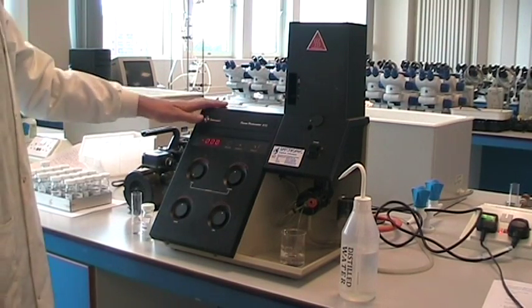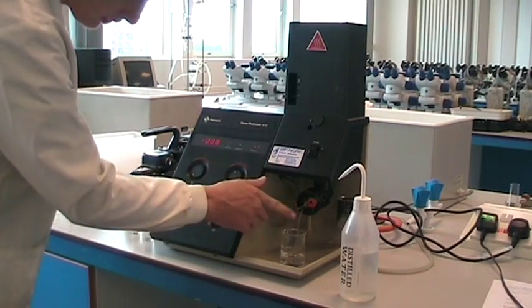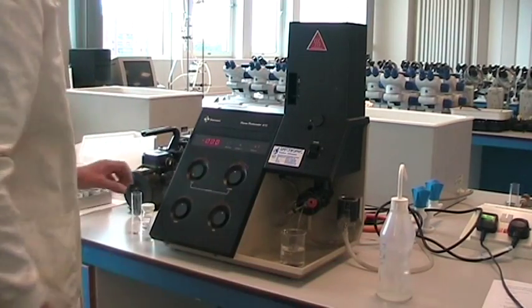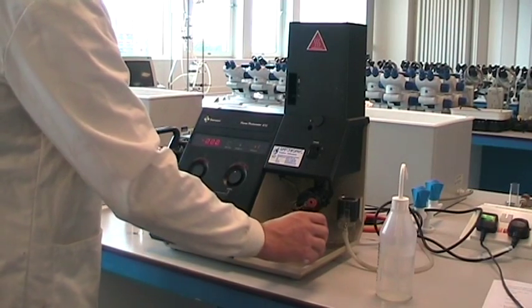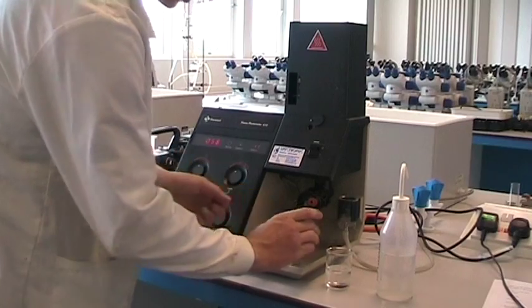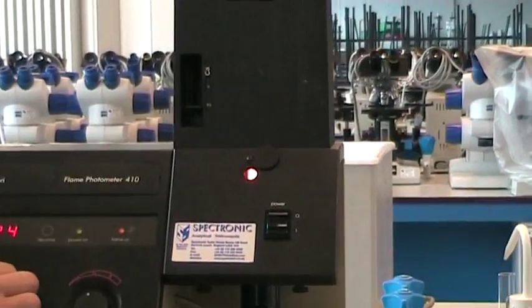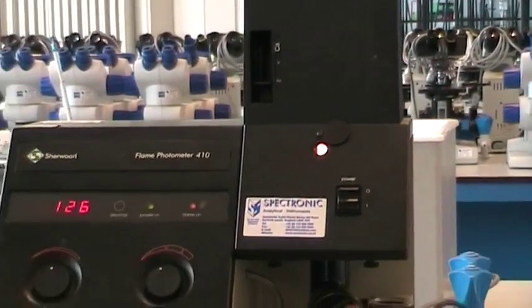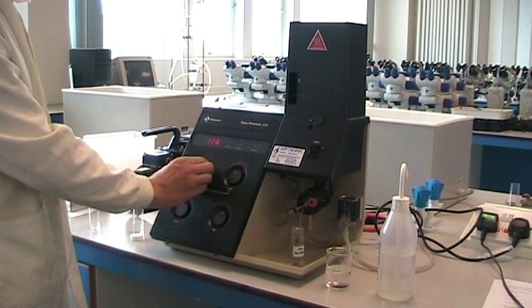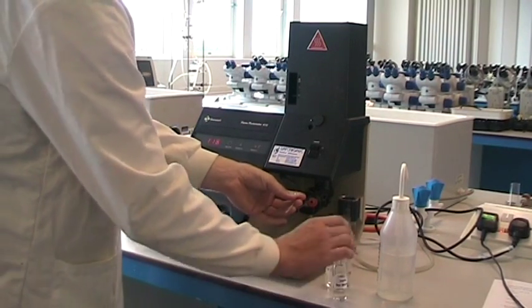This is a flame photometer. It is set to measure sodium ion concentration. It sucks water up through this tube here, so make sure that this reservoir is always full. Now to calibrate it, you will be using 125% sea water and adjust the reading to 125. That sets your highest parameter for sodium concentration.